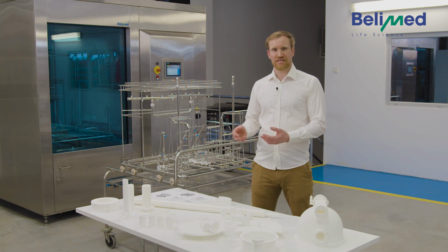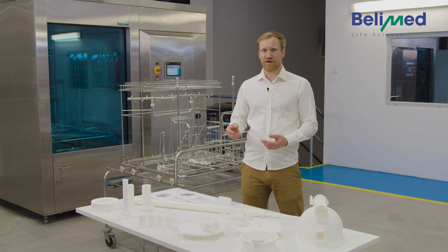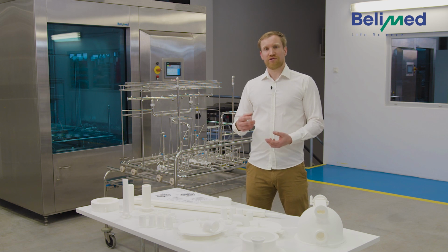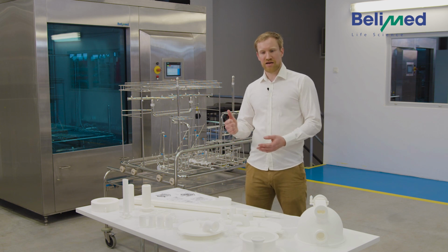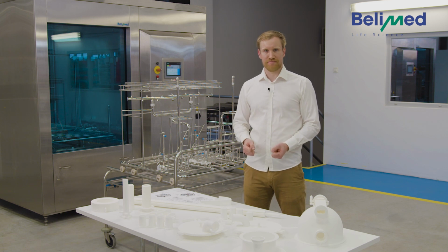But as it is a two-dimensional document, it's sometimes really hard to identify which wash goods need to be placed on which position. And also the orientation is really important. So now I would like to show you how to load the rack with the wash goods here in front of me according to the loading scheme.